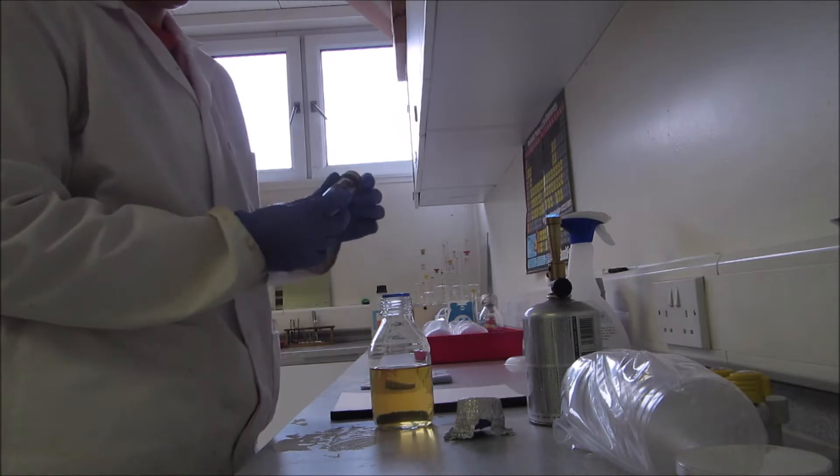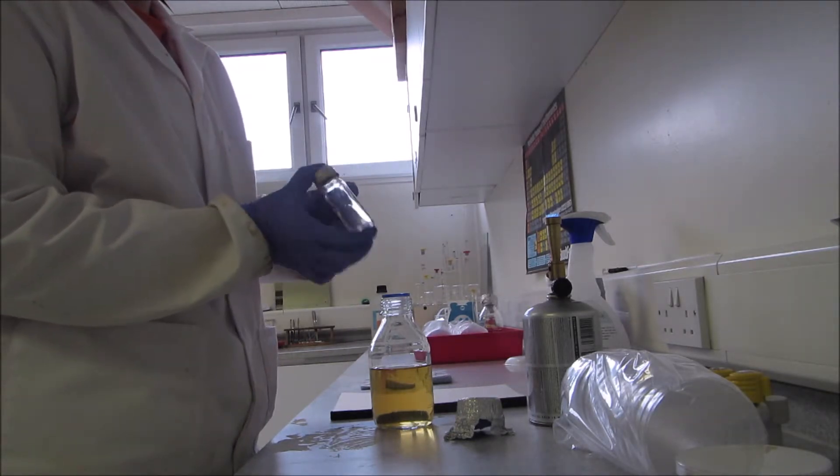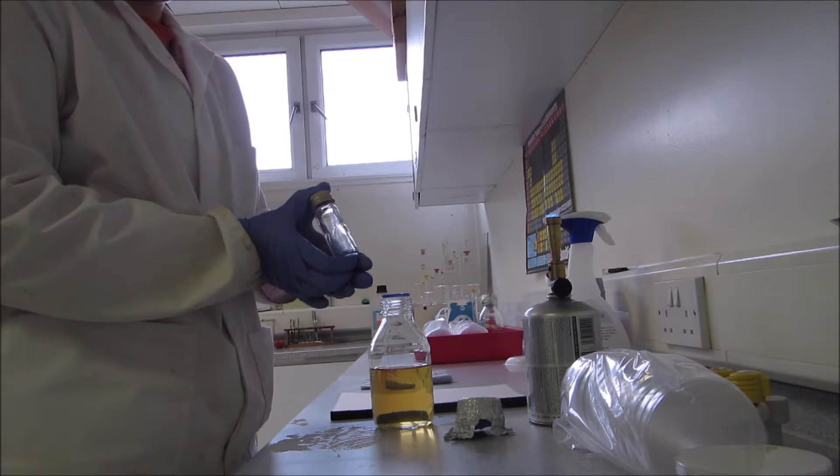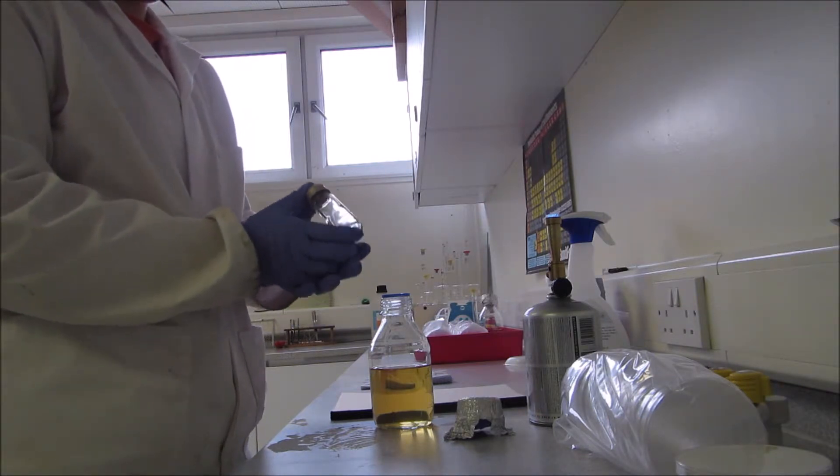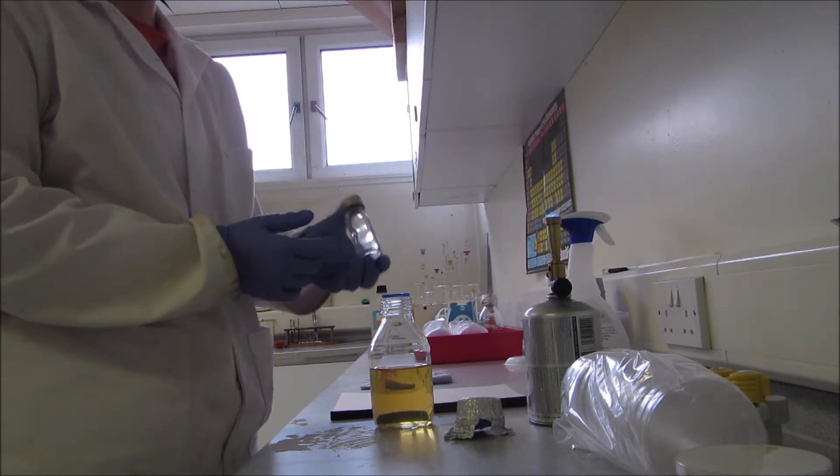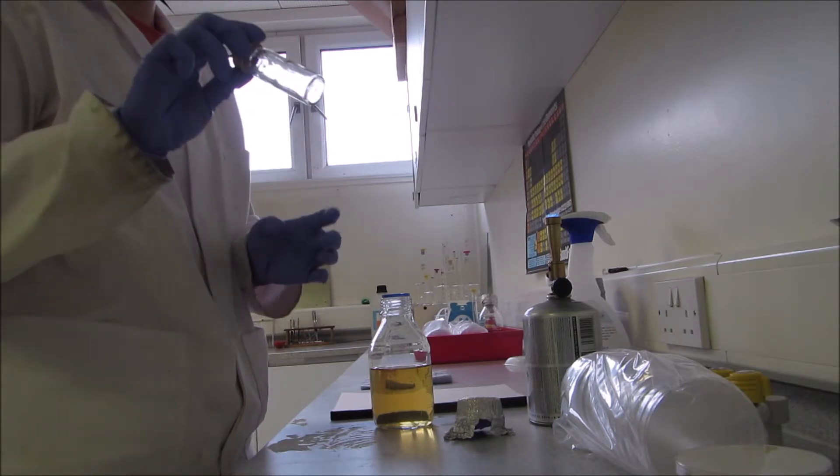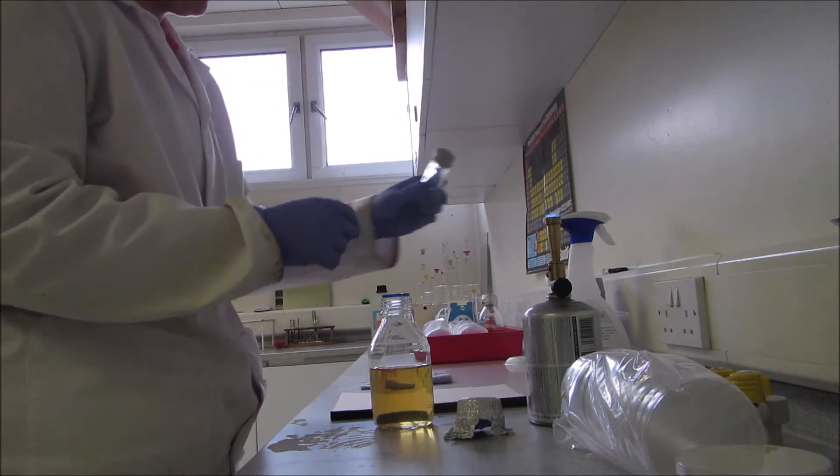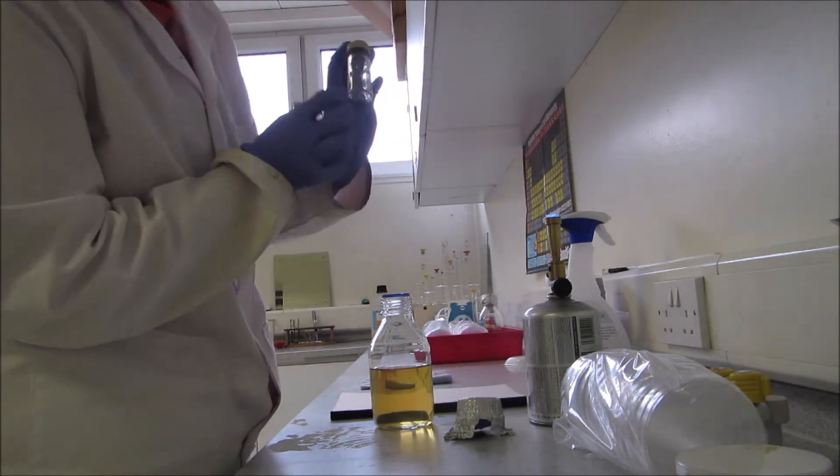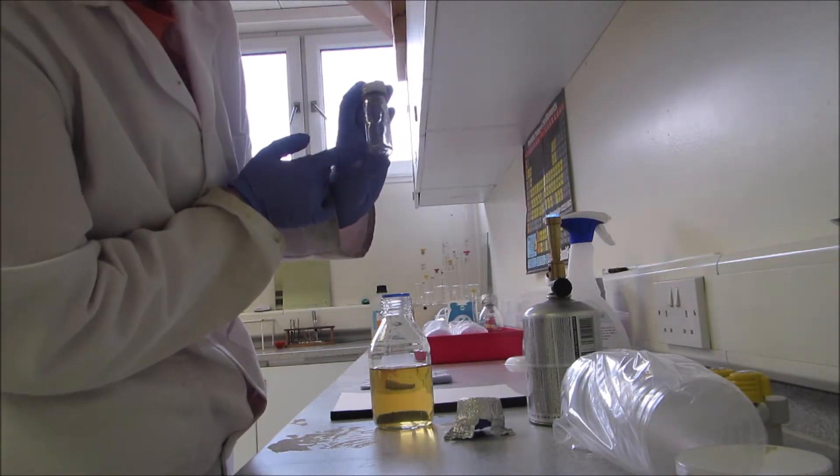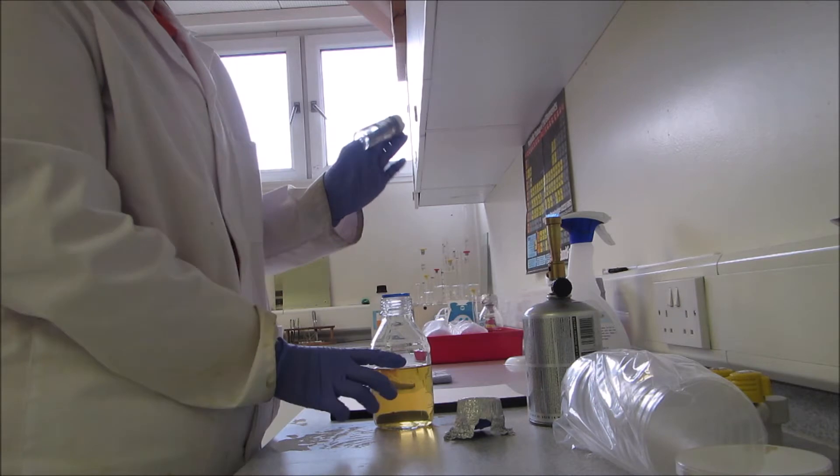To make a slope culture, I have these little vials that were autoclaved to kill off any microbes. Then I also put them in an oven at 105 degrees just to dry off the inside to make sure there's nothing there.